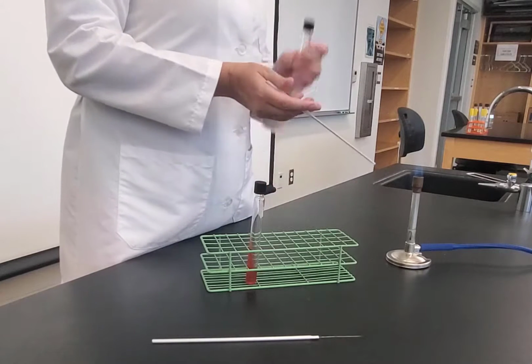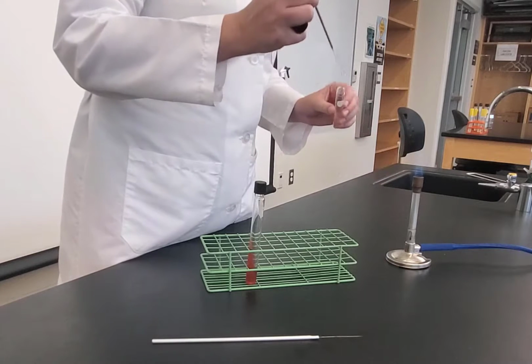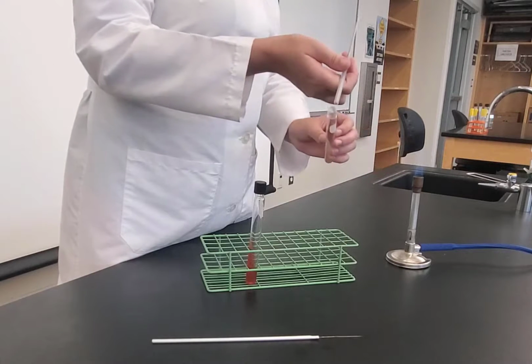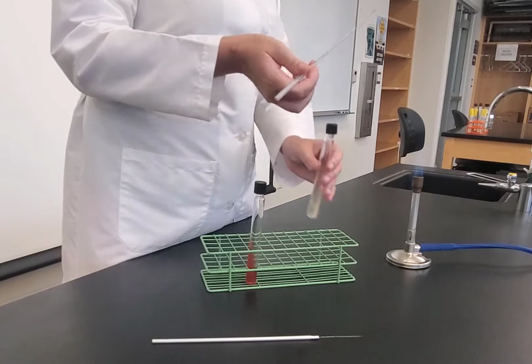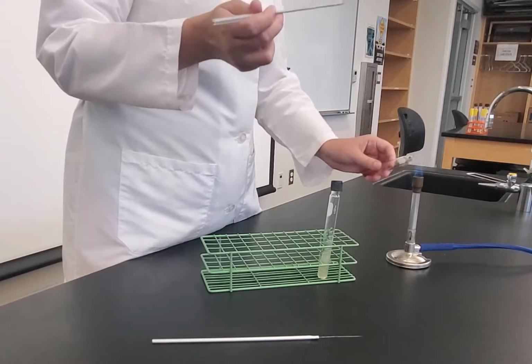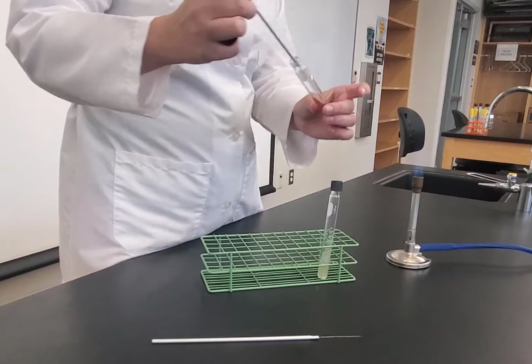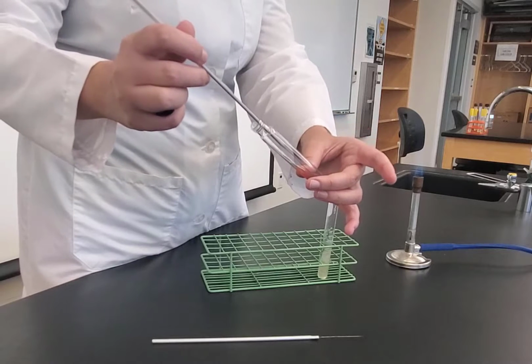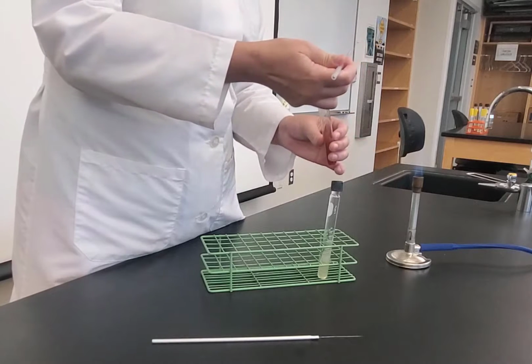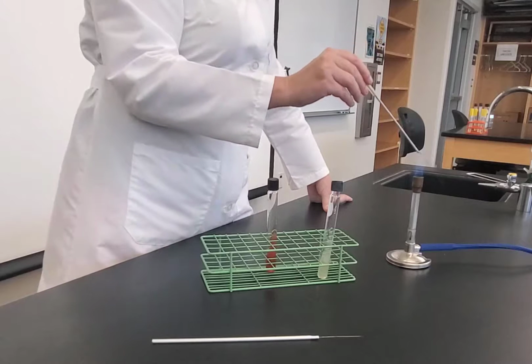And then I'm going to take the cap. Again, I'm going to pick up bacteria from the same tube, flame it, go in, pick up some bacteria, flame it. So now I'm going to do my zigzag inoculation. Flame it. Remember, you always flame going in and out of the tube. So I'm going to start again at the base of the slant, and I zigzag up, flame it, cap, and then I'm going to flame sterilize my loop.